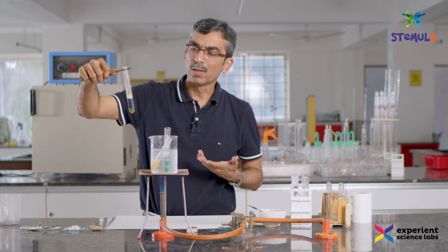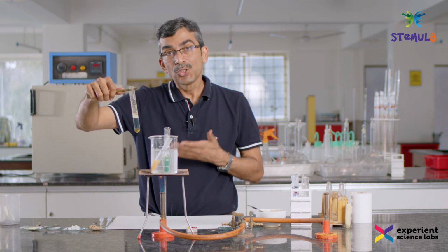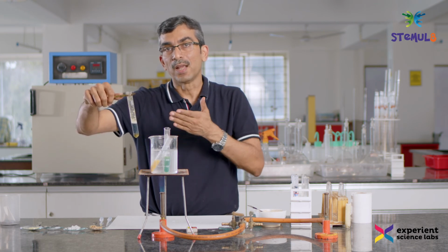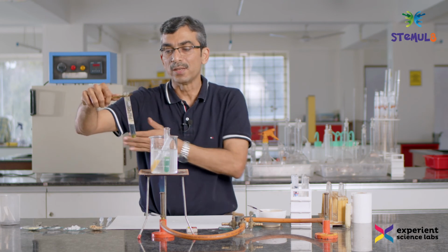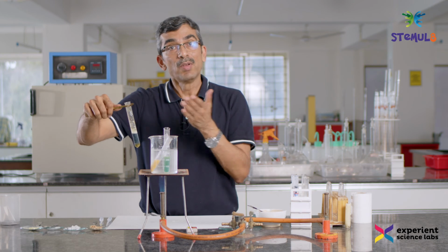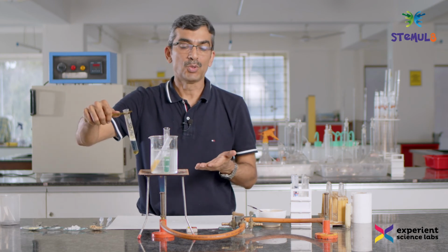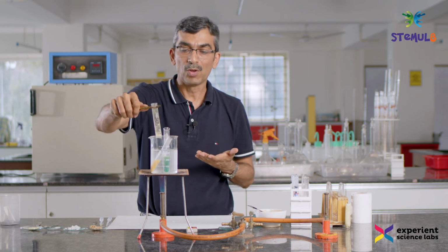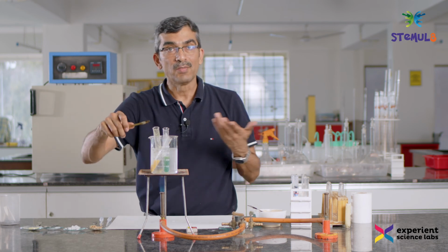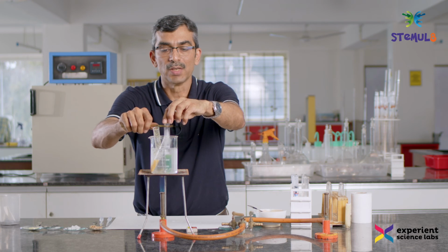This one has gotten a bit dark and it has remained blue. Typically if it has sugar in it, it will turn green or darker green and then yellow and then red. But I don't see that progression, though that doesn't mean that it doesn't have even traces of sugar in it. It doesn't seem to have a lot of sugar in it. So I will probably rule out the presence of sugar. If I am eating dal and I have diabetes, I will not be worried about eating moong dal. It doesn't seem to have sugar in it.